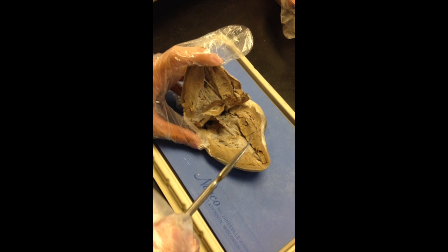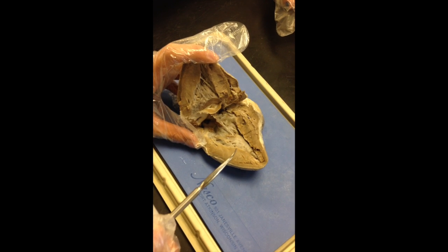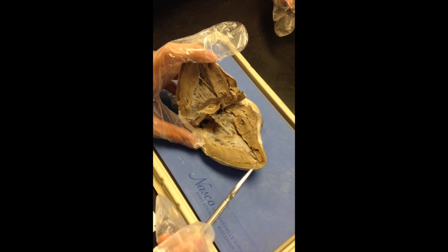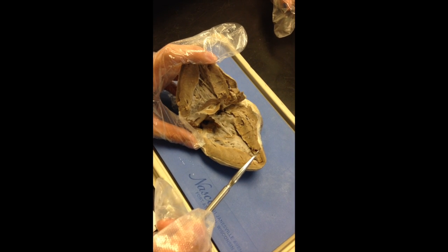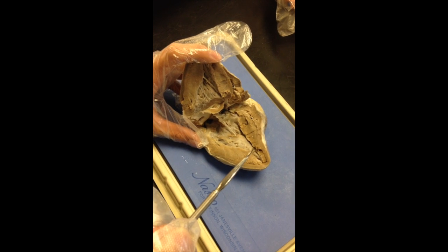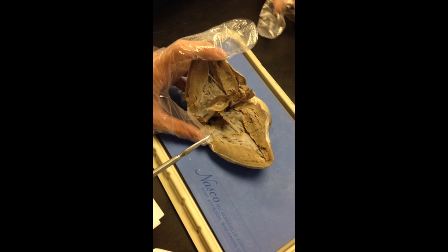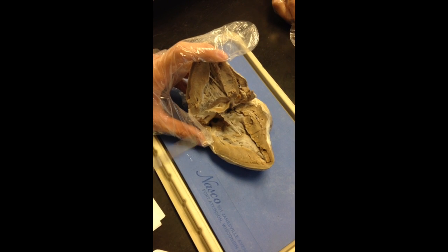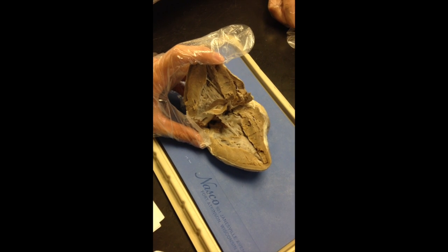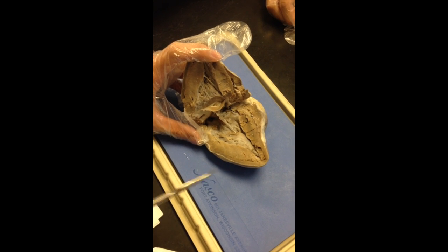And so the AV bundle is part of the conduction system of the heart that begins at the AV node. It passes through the cardiac skeleton, separating the atria and the ventricles, then extends a short distance down the interventricular septum before splitting into right and left bundle branches. The bundle branches are made up of specialized muscle fibers that transmit electrical impulses to the ventricles.